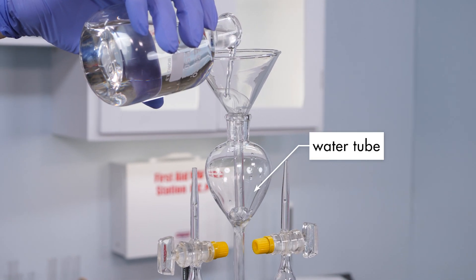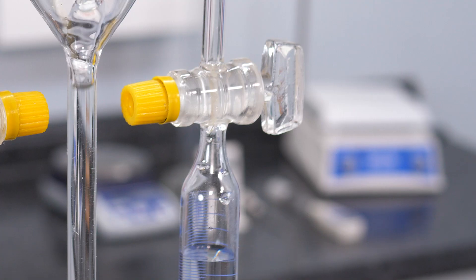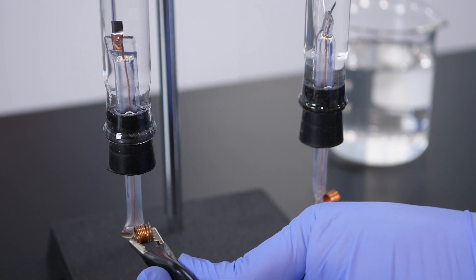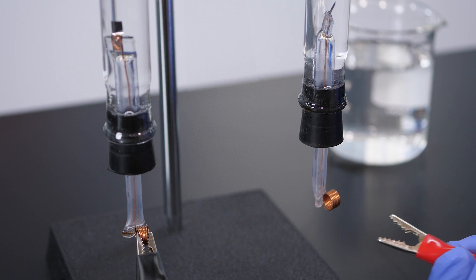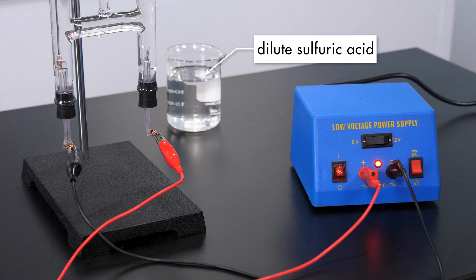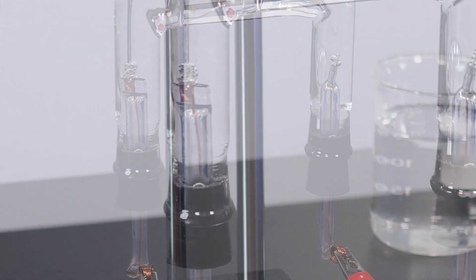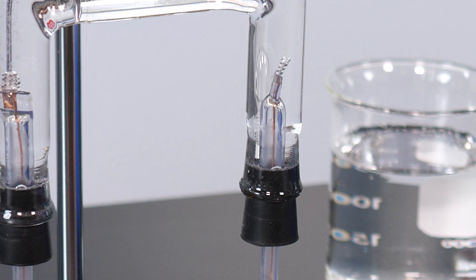Water is poured into the center tube. Notice that water flows equally into each of the collection tubes. As the collection tubes fill, the water pushes the air out of the collection tubes. When both collection tubes are filled to the top, we close the release valves. When the cables are connected and the electric power supply is switched on, an electric current flows from one electrode through the water in the apparatus to the second electrode. Pure water does not conduct electricity, so a dilute sulfuric acid solution was added to the water before we poured it into the apparatus. Notice that bubbles are forming at each electrode—this is an indication that the decomposition of water is taking place. Bubbles of hydrogen gas are forming at the electrode in the tube on your left, and bubbles of oxygen gas are forming at the electrode in the tube on your right.